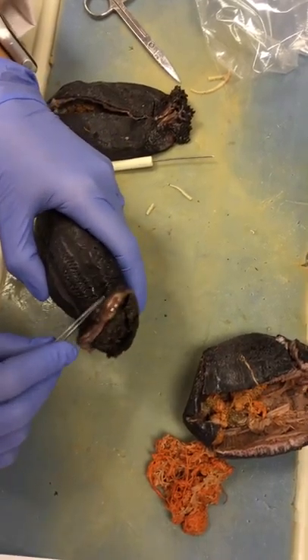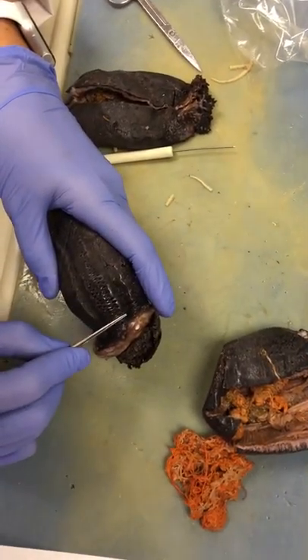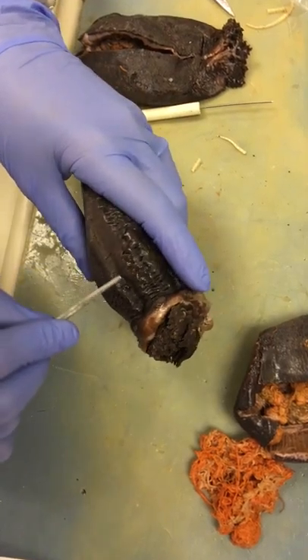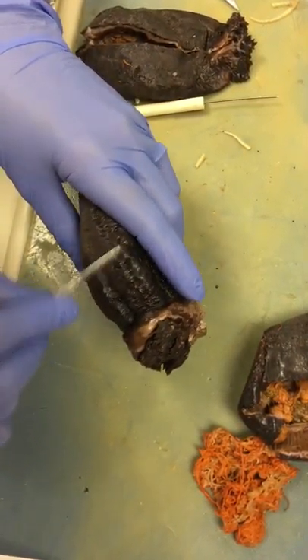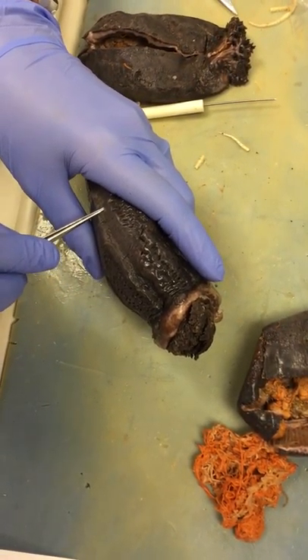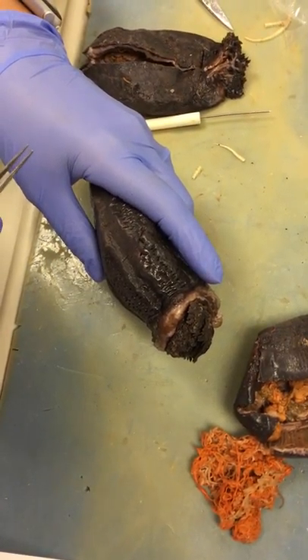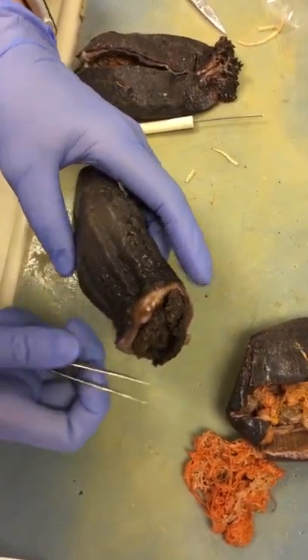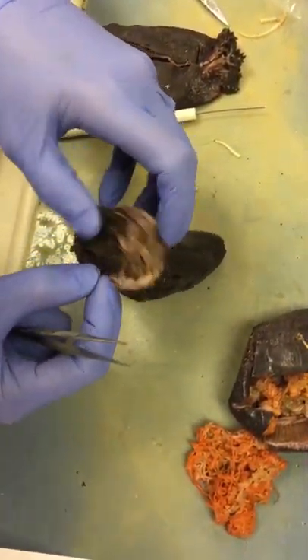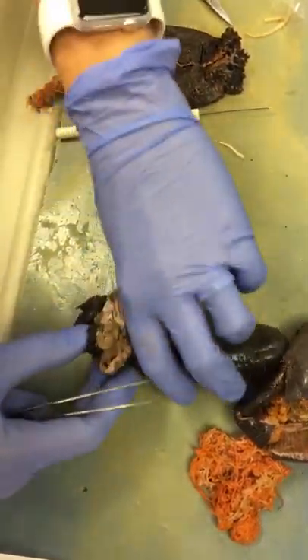We can see a few things on here. We can see where the tube feet are going to exit out, making this the ambulacra, and then the area between the ambulacra, this region where there's no tube feet, is the interambulacra — because 'inter' means between. These structures right here are actually tentacles.